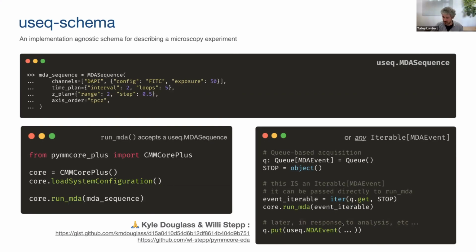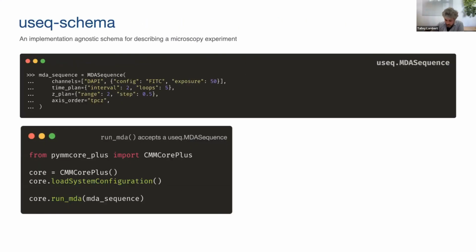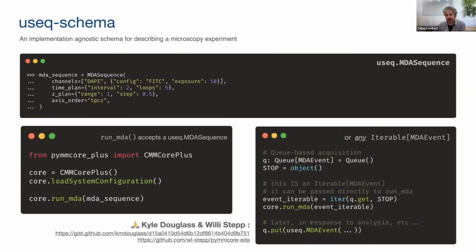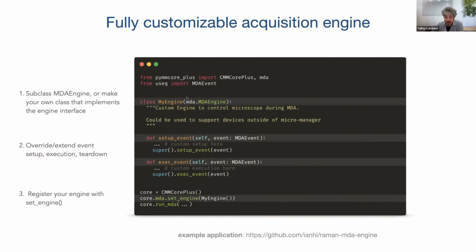And now somewhere else in their code, in response to analysis, they just drop events as needed into this queue. And this is all running in another thread now. And anytime it sees a new event, it'll execute it. You can code for waits, wait some period of time or something like that. But this now just makes a really nice pattern for event-driven custom acquisition. That provides quite a bit of customization just by having a thread running a thing, watching a queue, but you can also fully customize the acquisition engine itself.